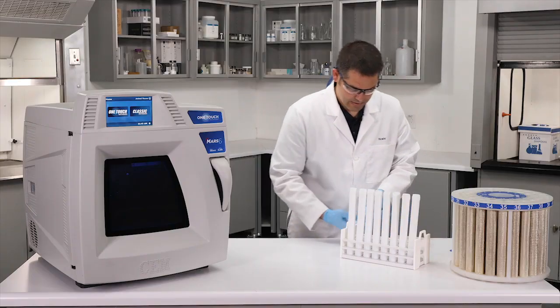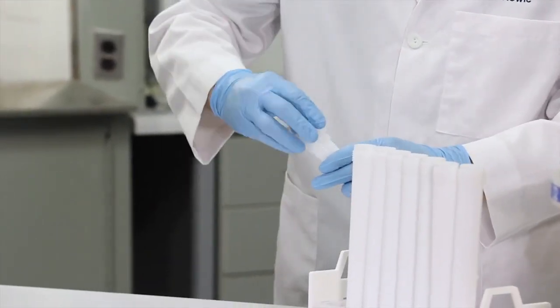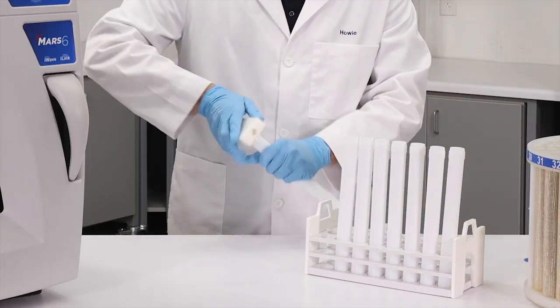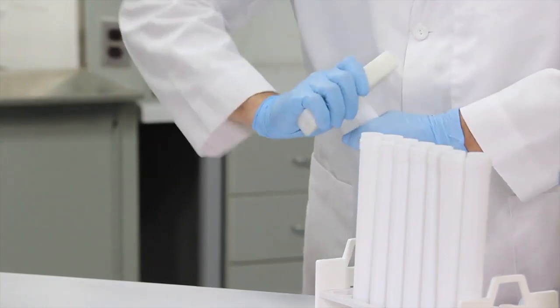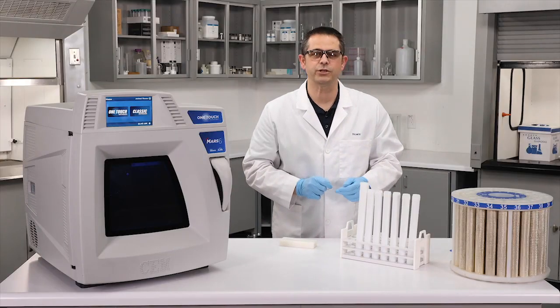Now I just need to cap and torque the vessels. So we just place our cap, torque down with our block. All right, I will continue to do this. Give me a couple minutes and I'll meet you at the microwave.